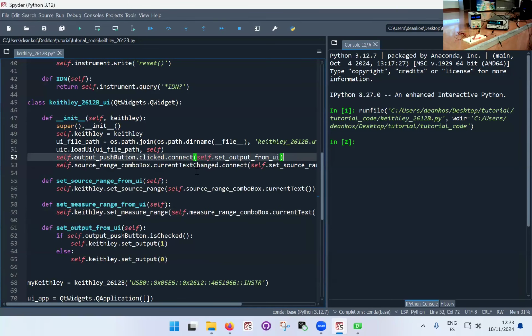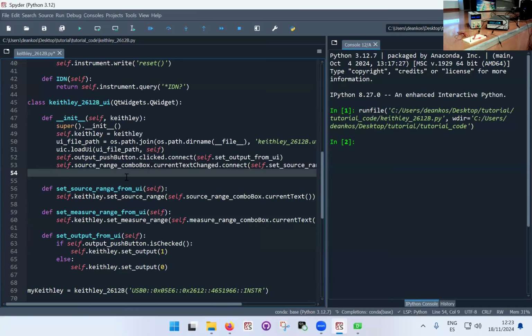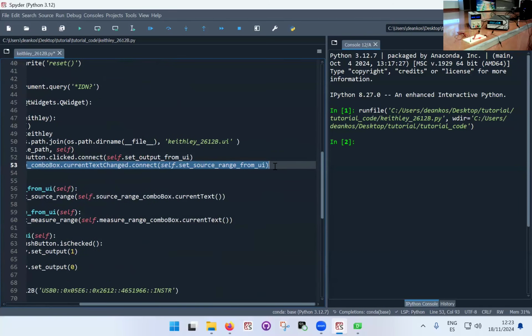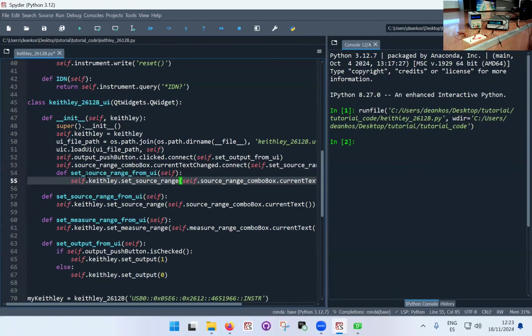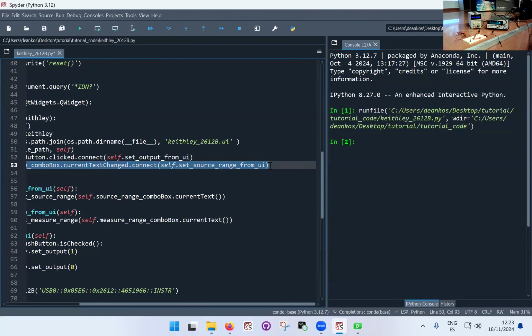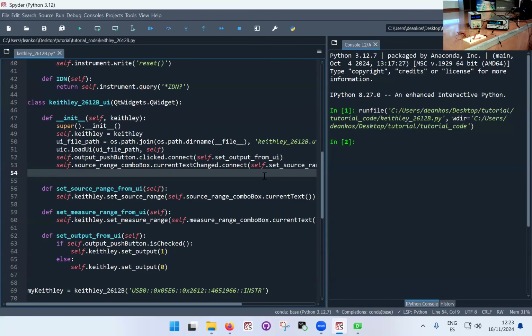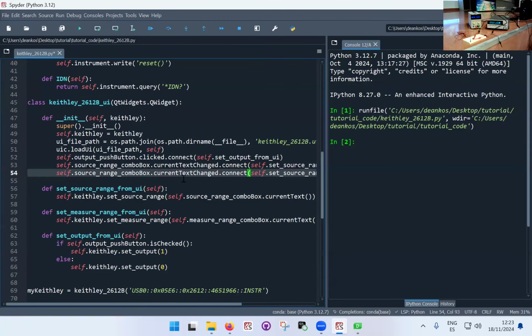And again, with each of these, I need to connect it. And I'm going to connect it with the same sort of feature as before. Except that now, it's a bit dodgy, this Control-C, I'm not sure why. It's probably something with a keyboard. I'm just going to copy paste it that way. So measure range.